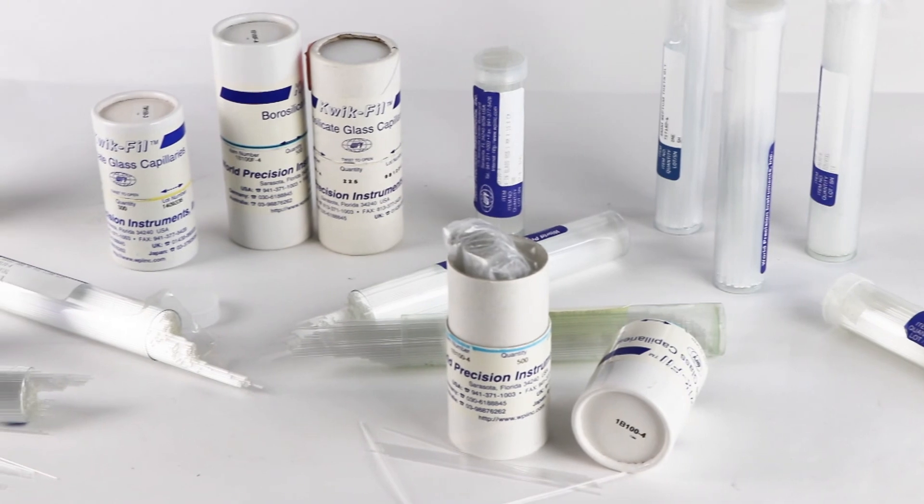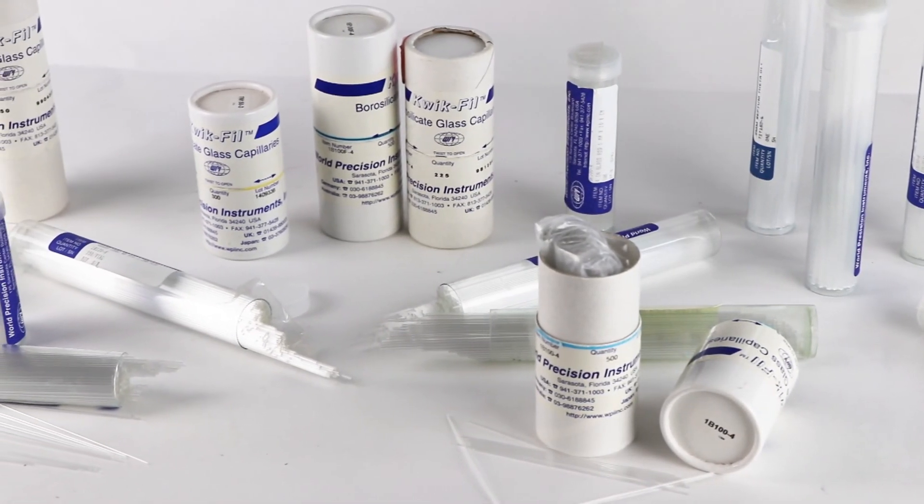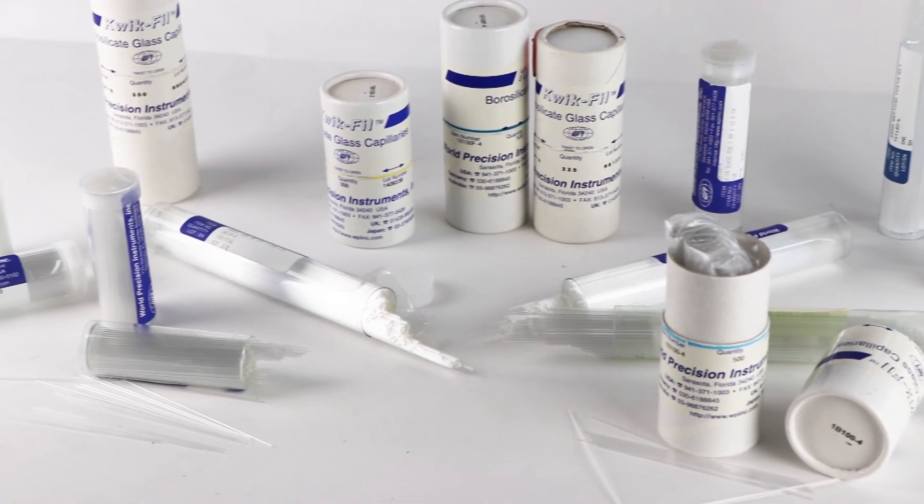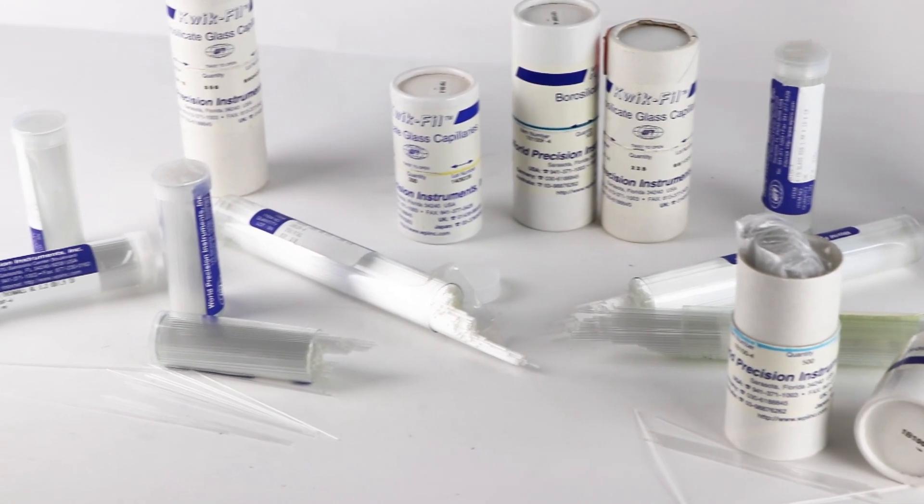Glass capillaries can have slight differences between lots. Each time you open a new vial of glass capillaries, recalibrate the puller's heat parameters for the new glass.